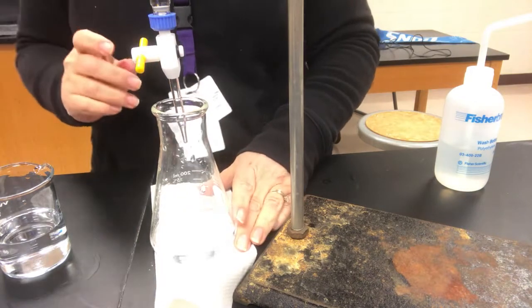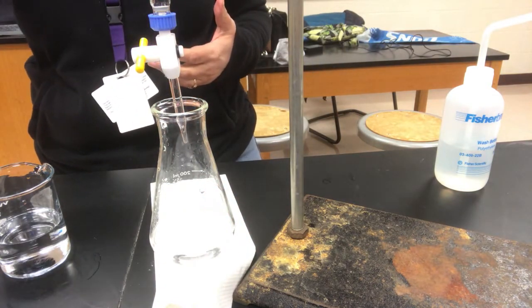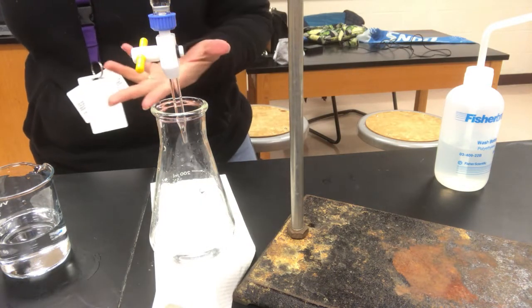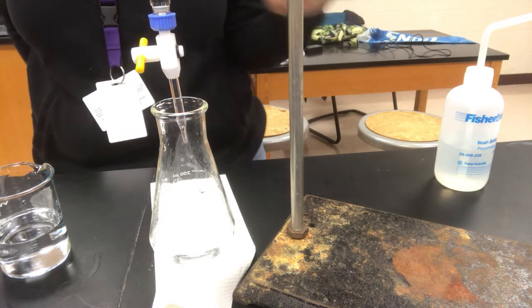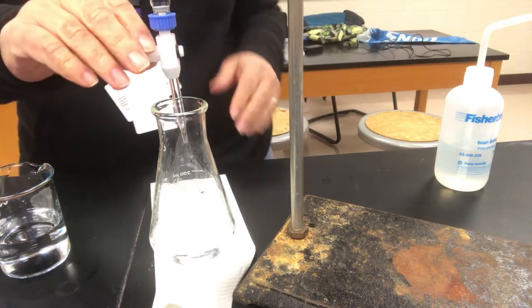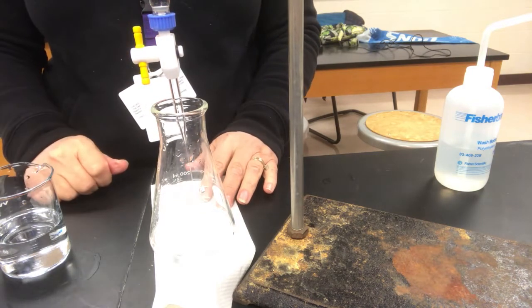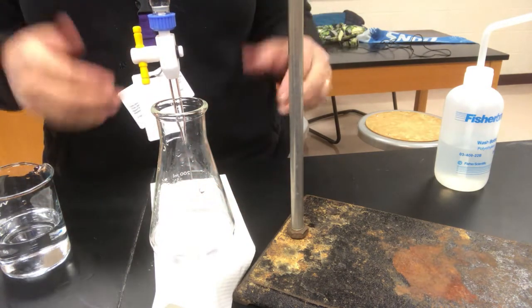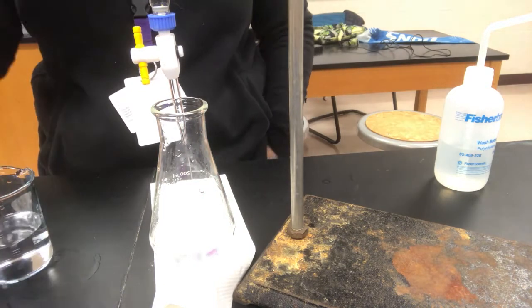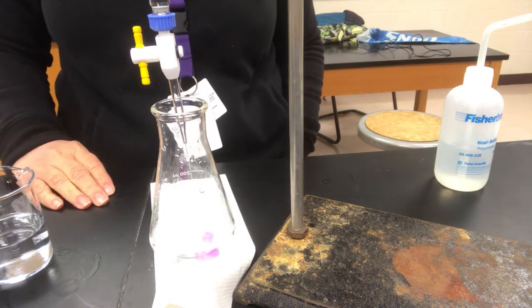So here we go. Because it's 0.1 molar, I know it's a little less than 0.1 molar if you calculated it correctly, and it's 0.2 molar hydrochloric acid, 0.1 molar sodium hydroxide, I should know approximately how much volume this should take. So again, in order to speed it up, I'm just going to open up the valve and let it rip until it's pretty close to what I think the tentative endpoint's going to be. Maybe I'll go within a mil of it, without worrying too much about going over.